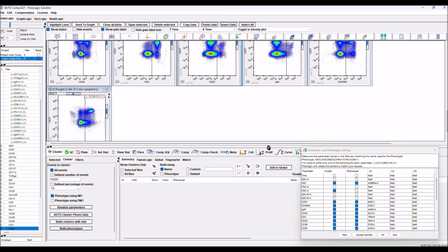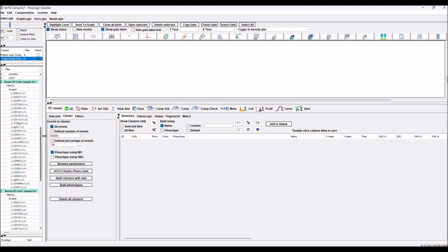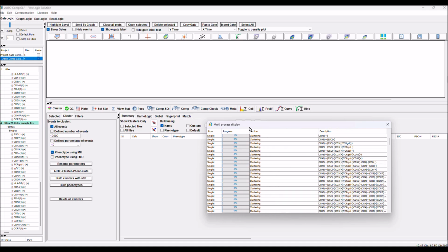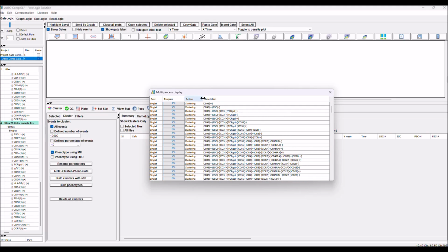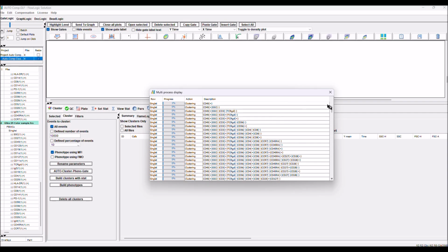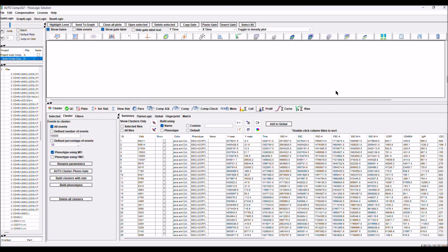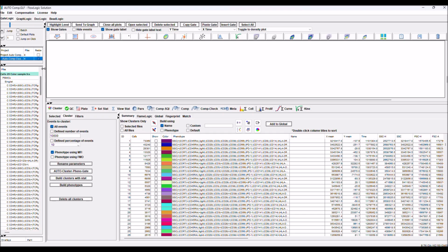So after we are happy with the position of the splitter, we just click all. What FlowLogic does is apply the splitter to all the files and start the process of first clustering and then phenotyping. Here you can see this is the table, and we have to extract all these populations for all the files. We still have a couple of phenotypes to go, and when it's finished the multiprocess will close. That's it. Multiprocess is closed, and now we can go and check the result of what we did.